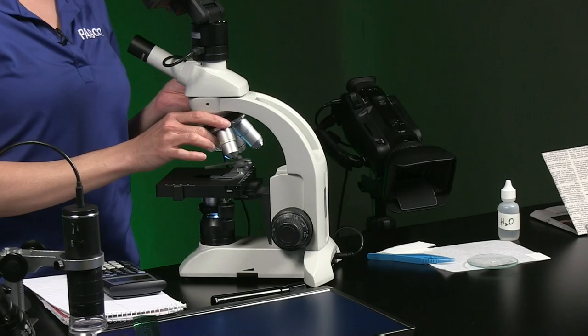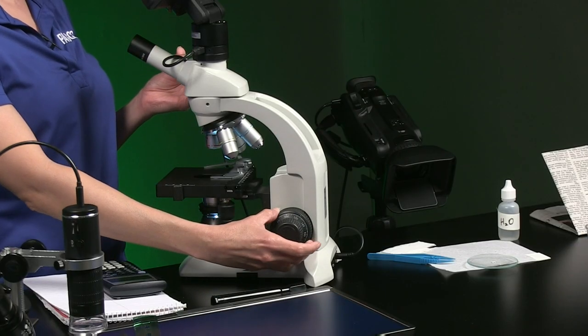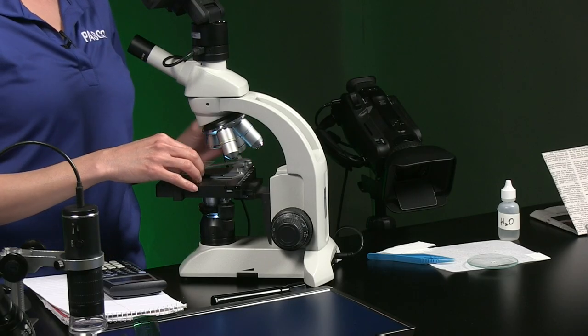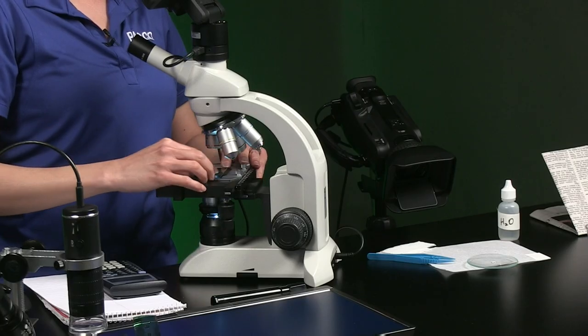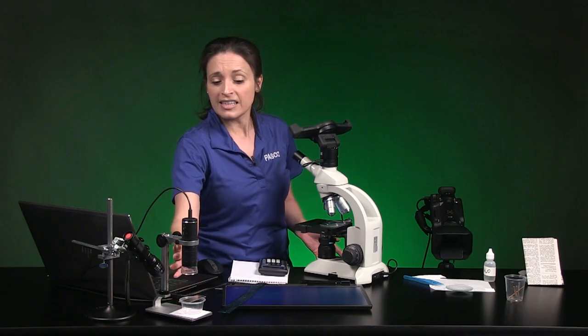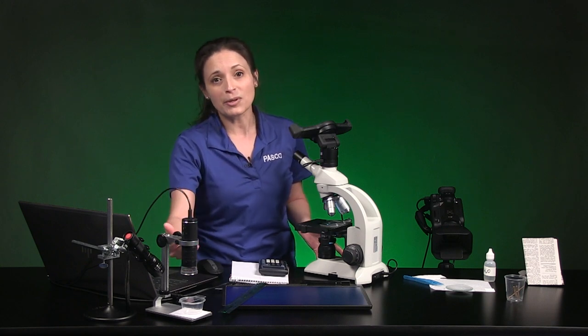On the compound microscope, make sure the objective lens is set to the lowest power — this objective has a magnification power of 4x. Use the coarse focus knob to lower the stage as far down as it can go. Use metal clips or a slide holder on the stage to secure the slide so the letter E is in a normal reading position. If using a single lens microscope, move the lens and stage as far apart as possible. Now is a good time to pause the video and review questions 1 and 2 on your answer document so you know what to look for.